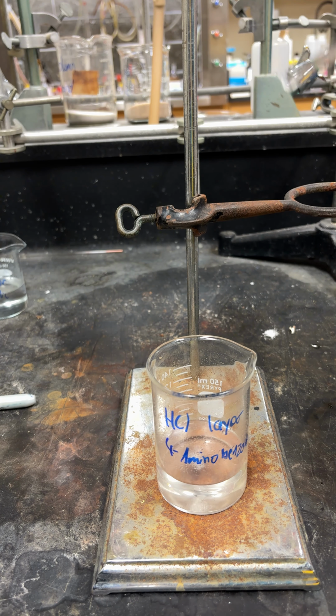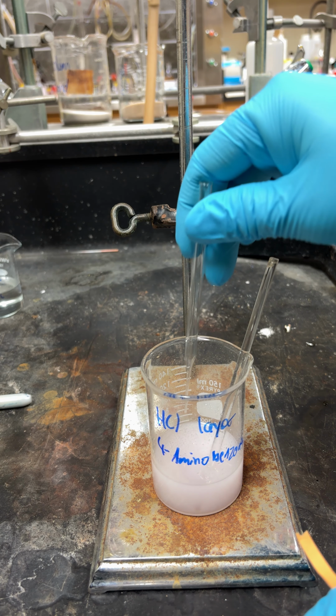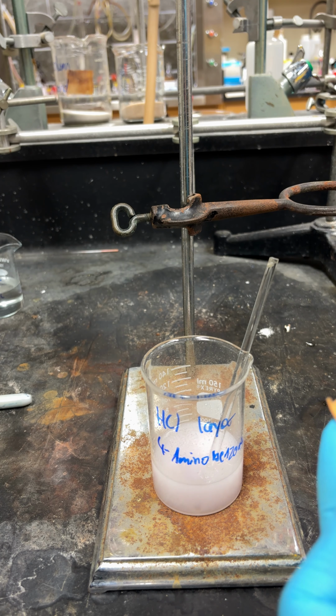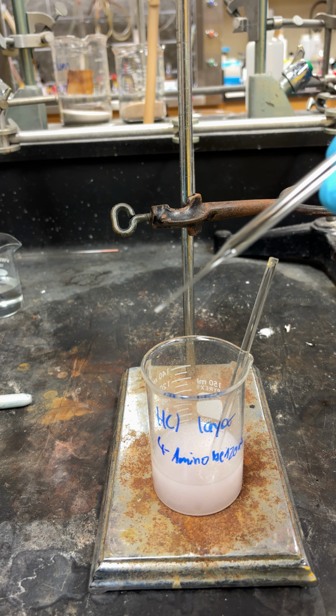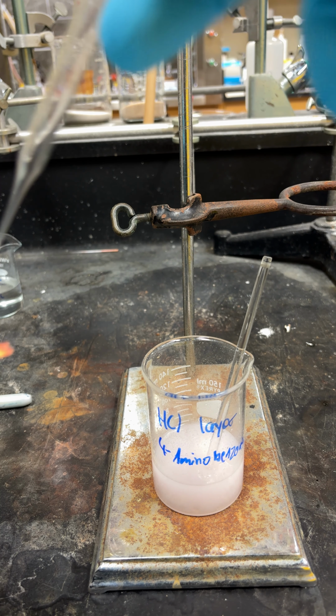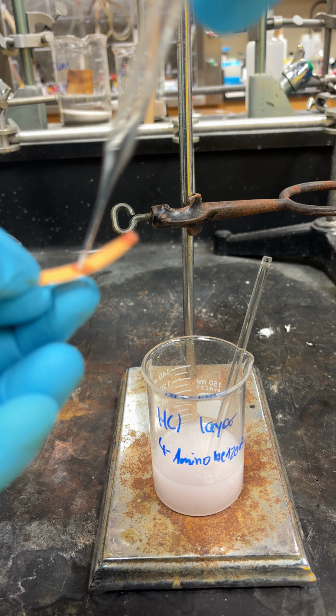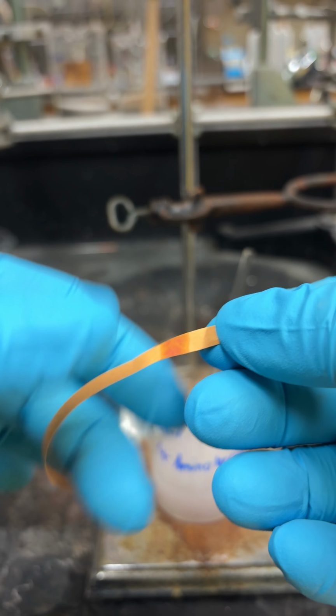So while you're doing this, you're going to want to check the pH of it periodically, because you just need to basify the solution. So the way to do that, so you don't waste a lot of paper, it's just more efficient, is you take a Pasteur pipette, and you just dip it in there, just fill the end, and you just take it and put a few drops on your pH paper. You're waiting for this to turn blue, meaning it's basic.